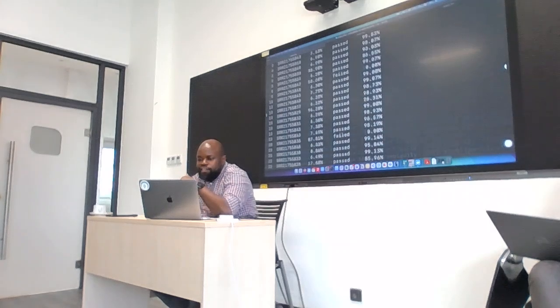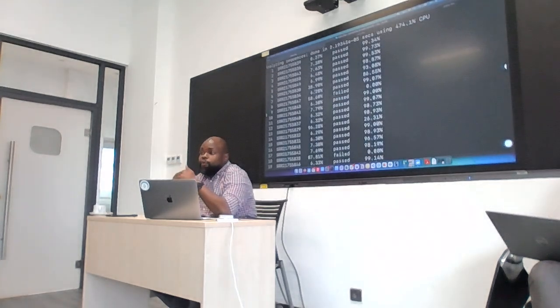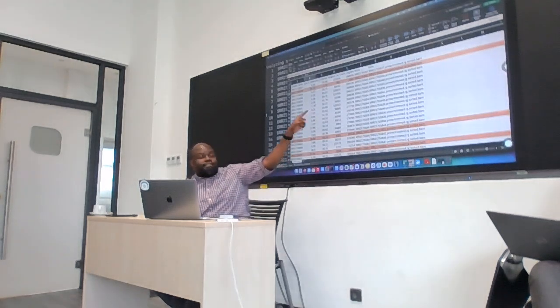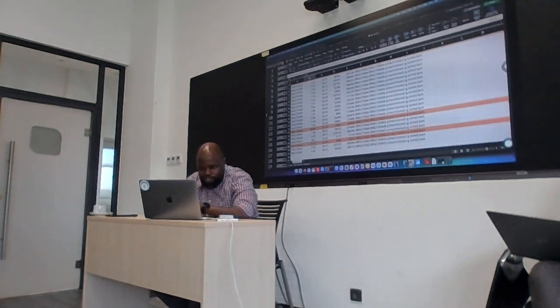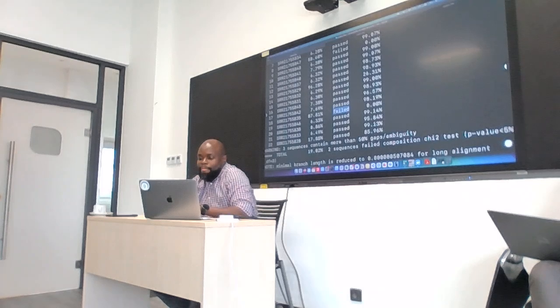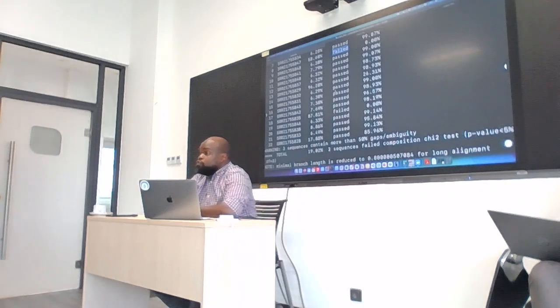So then it read in the sequences. Then it also does its own sort of QC. Okay? And you remember we had 3 sequences that had a very high number of Ns. From EpiCoV, we had this file, right? One of the sequences had 96% N, another had 38% N, another one had 87% N. Let's see if we can find them here. We can see there is this one that has 96% N, this one has 87% N, and IQ-TREE thinks it has failed. Okay? I don't know what it bases that on entirely, but again, this can also help you decide whether you want to remove those sequences or not. Okay?